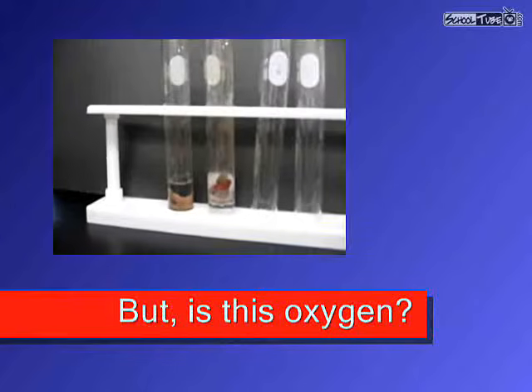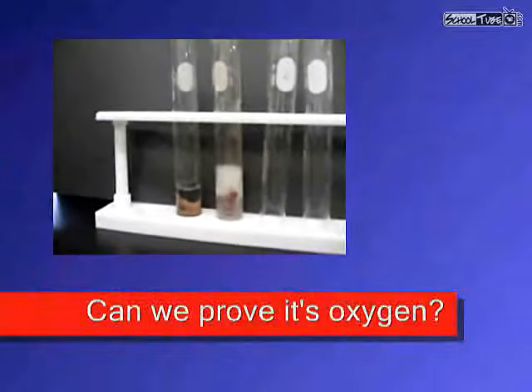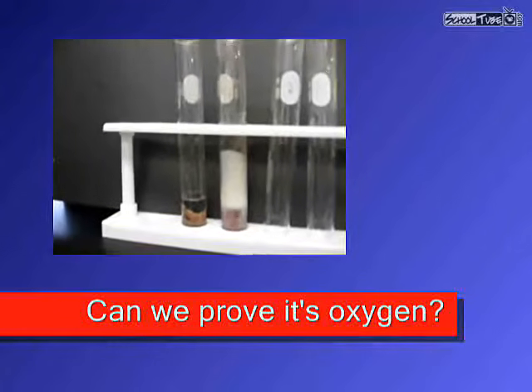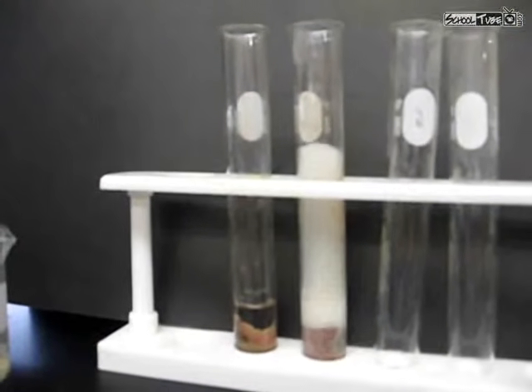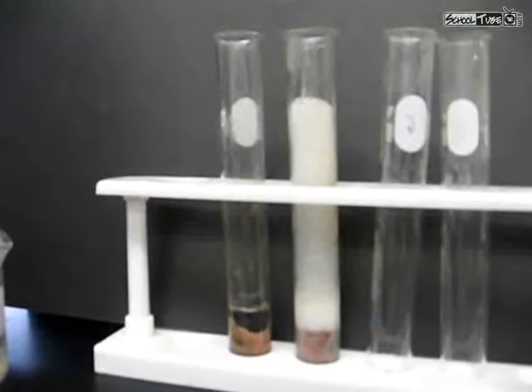And notice this time there is a reaction. But now the question is, do we know for a fact that the peroxide is being turned into water and oxygen? We're not quite sure what those bubbles are. So that's actually what we'll prove later. So as these bubbles rise, the liver enzymes are turning the peroxide into, hopefully, water and oxygen.